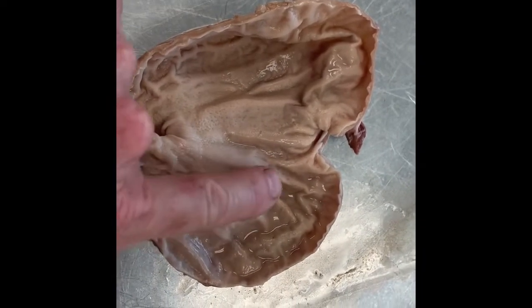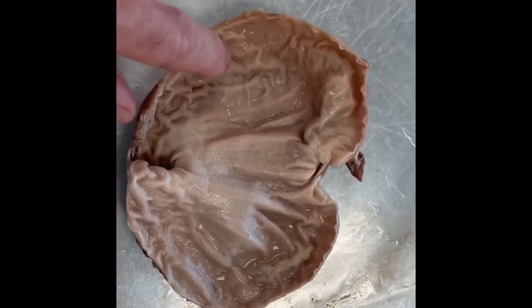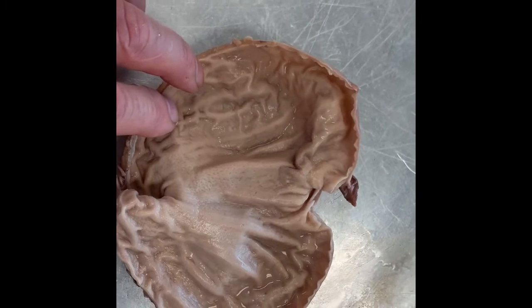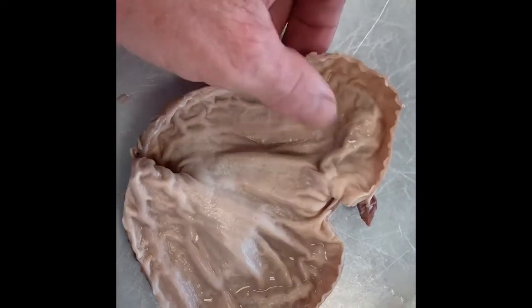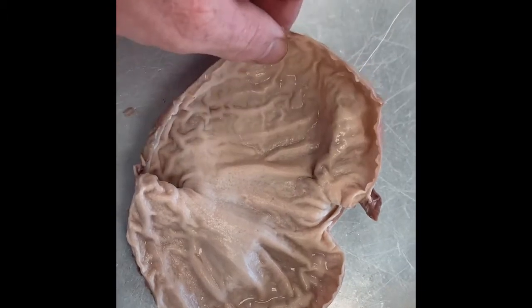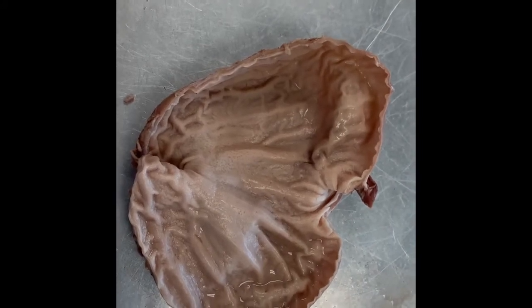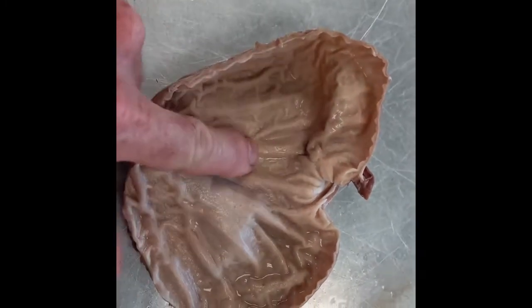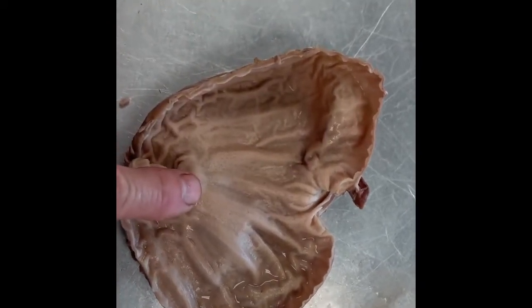all these folds in here are called the rugae, and when your stomach is empty, the folds appear and they're more pronounced. It's kind of like an expandable pocket on your suitcase. Well, what happens is as this gets full, these rugae disappear, and then the stomach is able to distend and maximize its volume, like a post-Thanksgiving dinner. And if you're fasting, when you wake up in the morning, the folds are going to be more pronounced because there'll be very little material inside of your stomach lining.